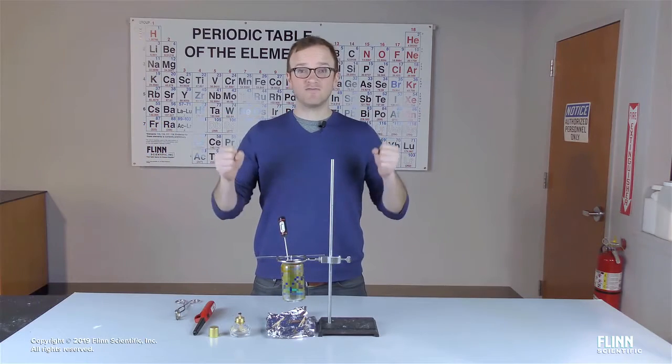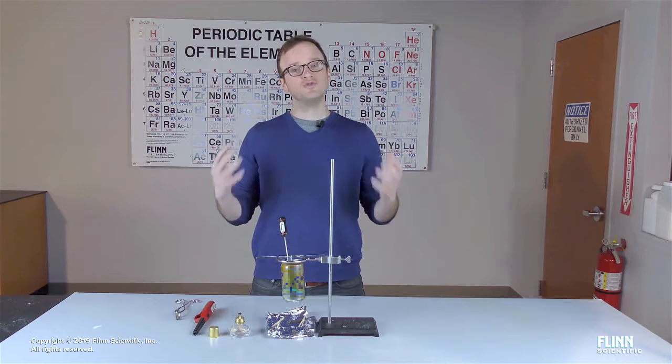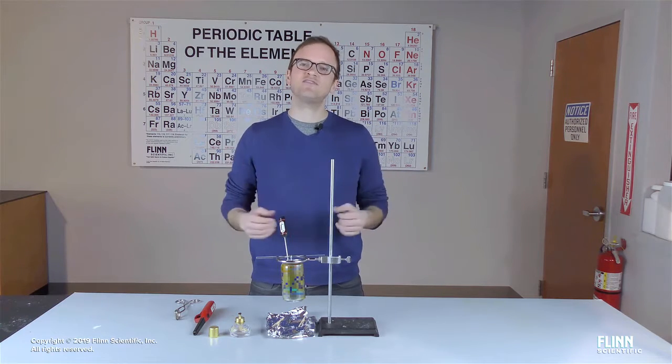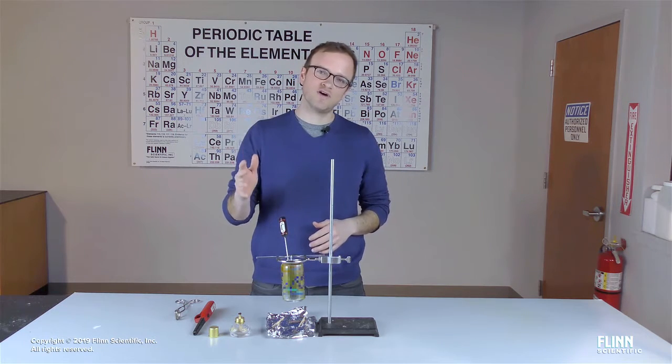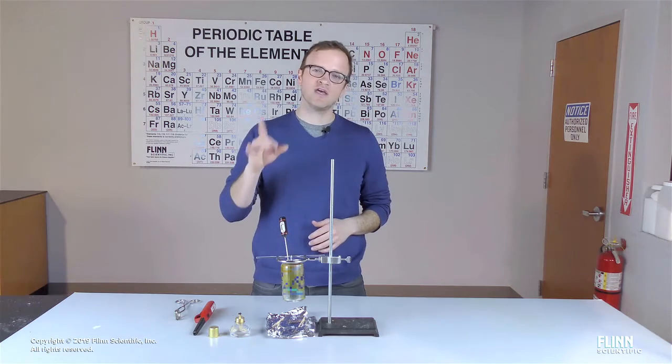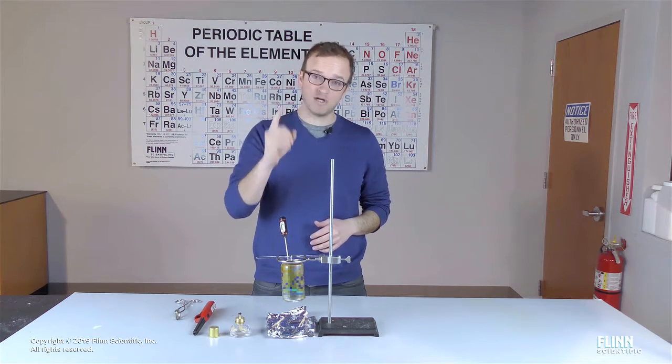In this lab, we are trying to make sense of forest fires. In order to do that, we have to get to the scientific principle at the crux of forest fires, and that is a chemical reaction, more specifically, a combustion reaction.